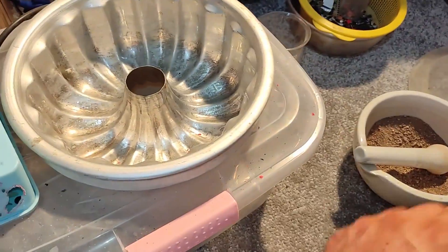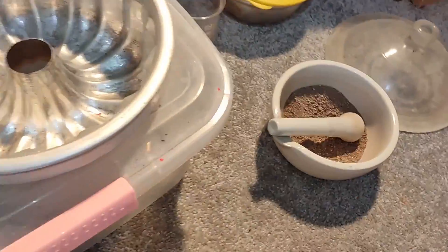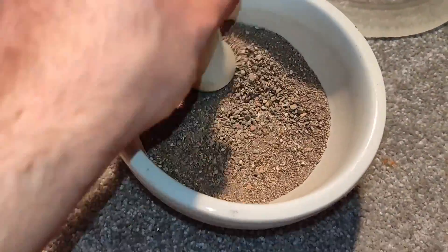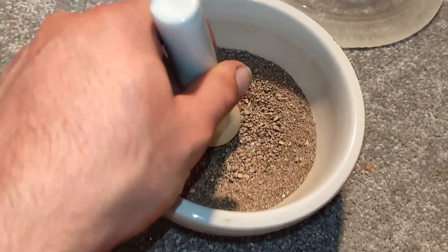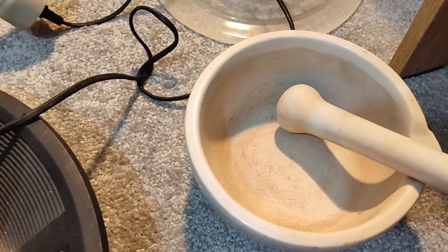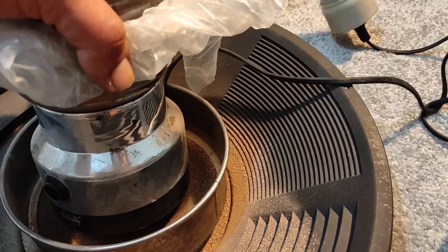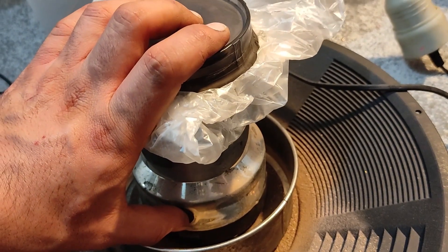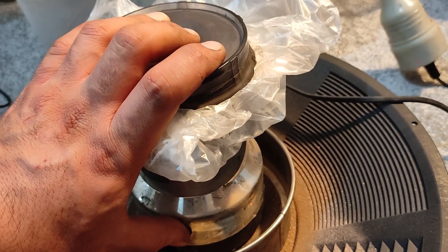It's pretty easy to wash out the lighter iron sulfide with a gold pan or concentrator machine. But since some gold is stuck inside the crystalline sulfide, I need to crush them finely. Using a mortar and pestle wasn't really a good idea, so I switched to using an electric grinder to get as fine a powder as possible.